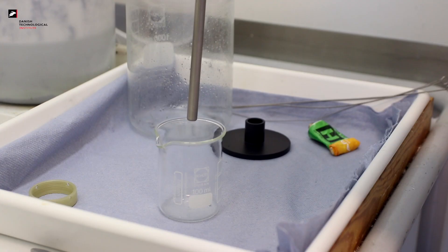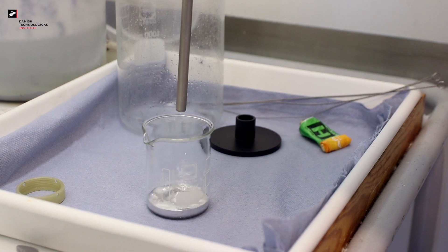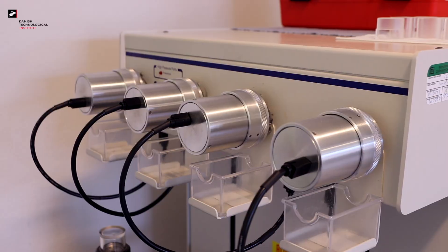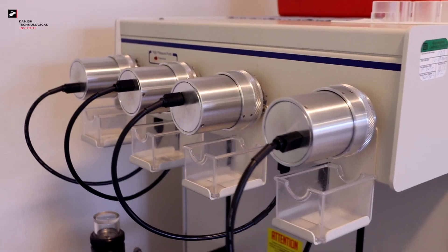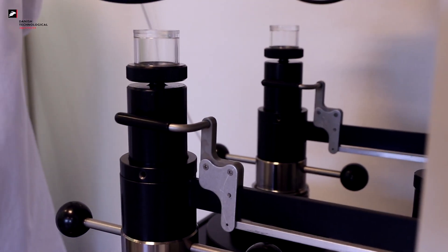Furthermore, this instrument has wide flexibility which allows you to tune all the parameters exactly to the material that you need to measure. We can measure both powder samples and solid samples. Our instrument has four ports of low pressure and two of high pressure, which means that we can measure several samples in one go.